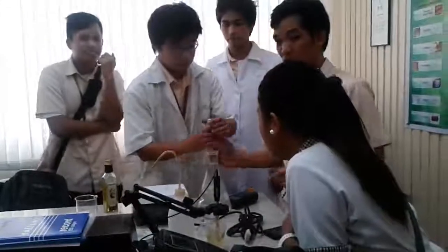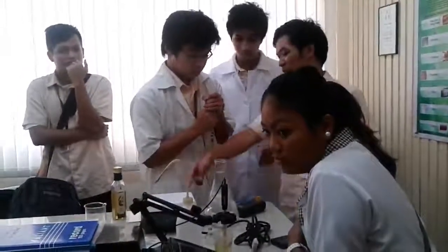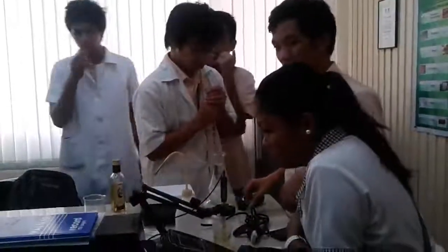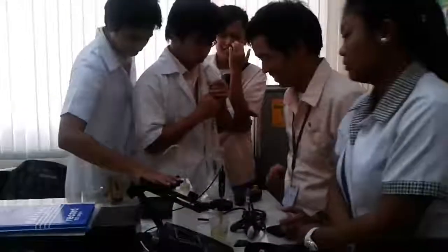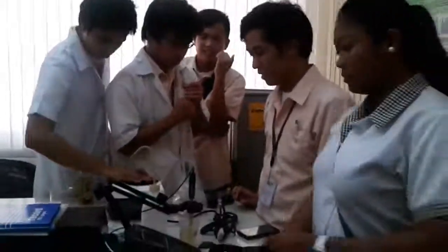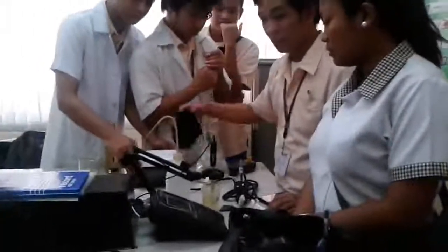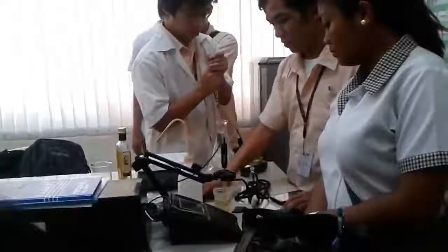So there are easy ways to measure some physical properties, and viscosity is one important property.